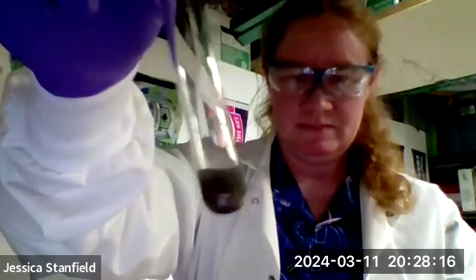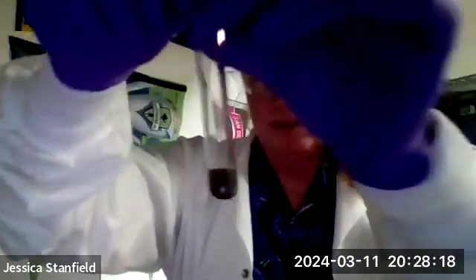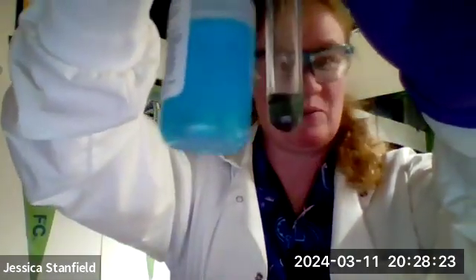Okay, I'll add another piece of aluminum foil. We'll see if we can get more of it to go. Yeah, we're losing more of that blue and we're getting more of that copper forming at the bottom. So again, I can hold up the original reagent bottle, definitely not the same color anymore, as we've reacted that copper(II) ion and we're now precipitating out solid copper.